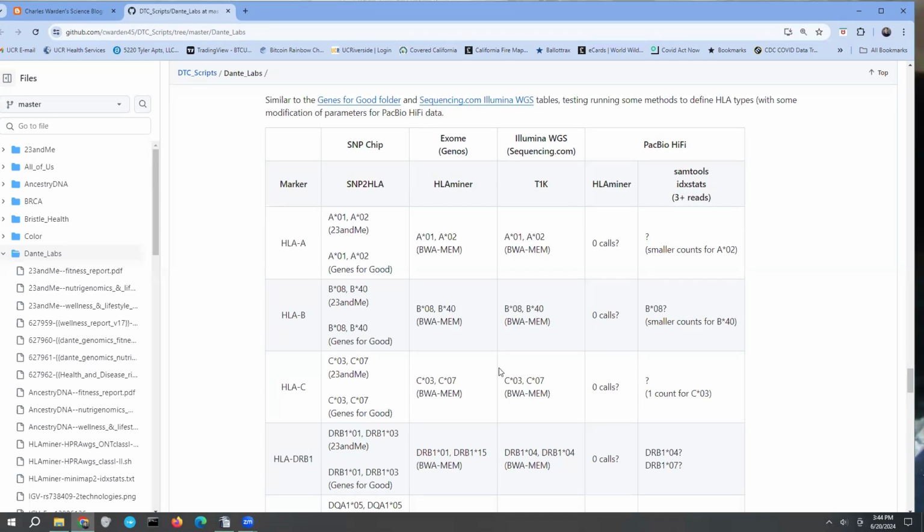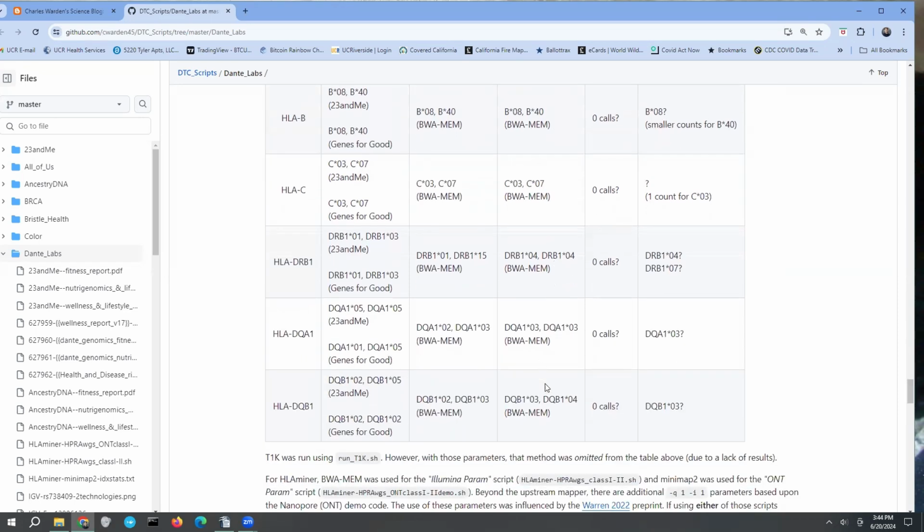Because with HLA A, B, and C, now it's actually less clear for the HiFi data than the Illumina data. So that's really the issue. I was hoping to get even more confidence about whether or not I'm DQ8 with a non-risk allele, or whether I'm DQ8, DQ8. Those are the two interpretations that I would be trying to decide between. The long read data was unfortunately not really helpful at this particular moment, although part of the reason for sharing it together is to try to get feedback, so that when I'm able to look into it more, potentially I could try other methods. And again, after a sufficient period of time, I'd like to have more long read data, maybe of a different type.